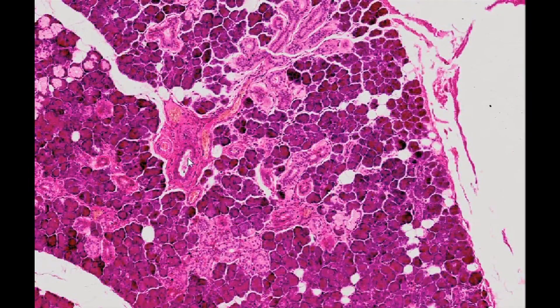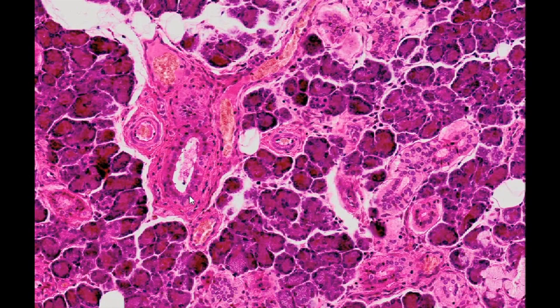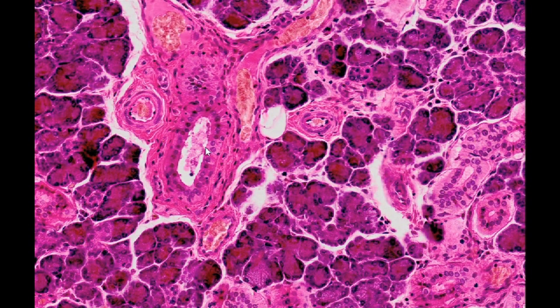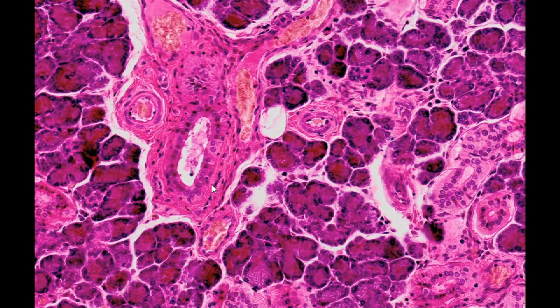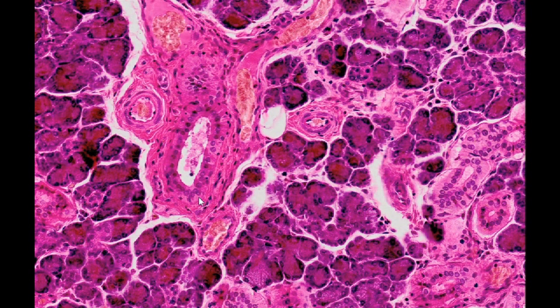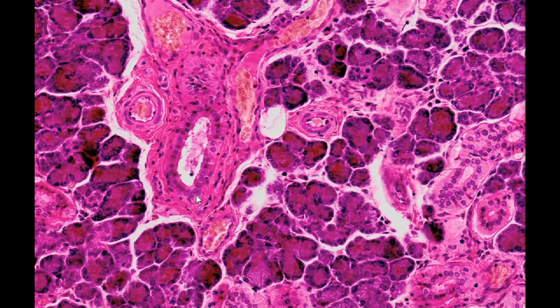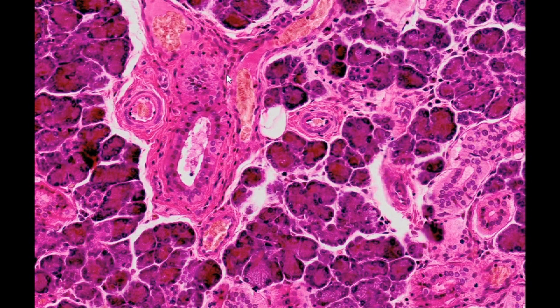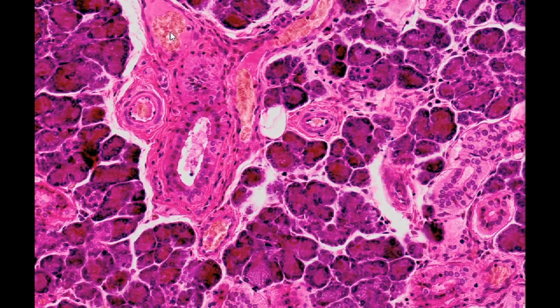The striated ducts connect and form the interlobular ducts, lined with simple columnar epithelium, the height of which increases up to pseudo-stratified epithelium, which is visible in the presented specimen. These ducts are surrounded by connective tissue with blood vessels.